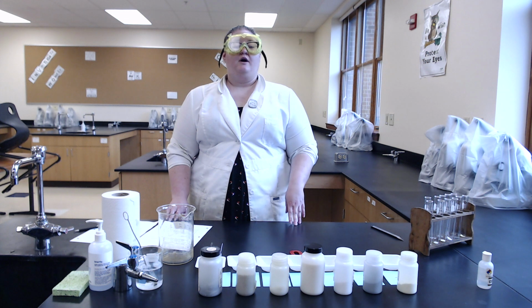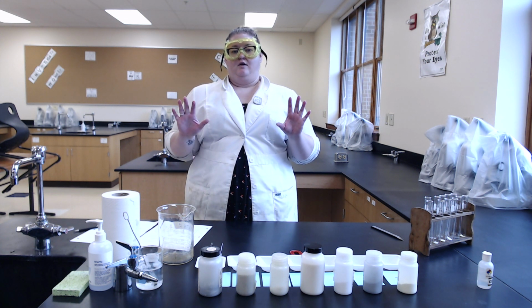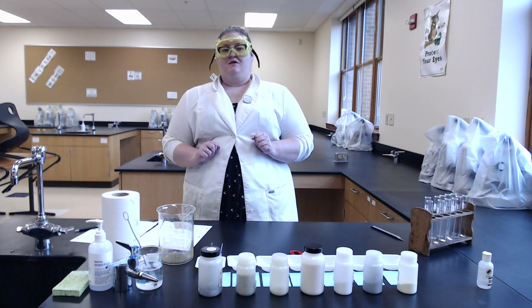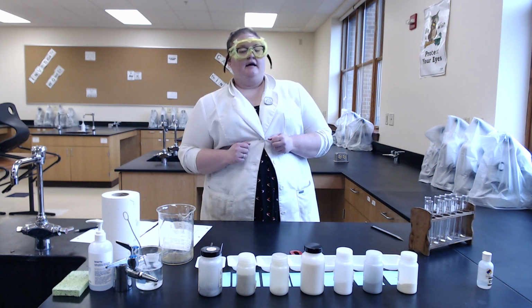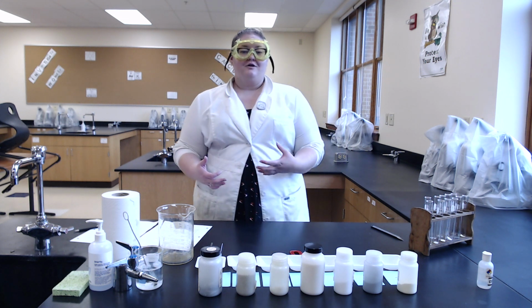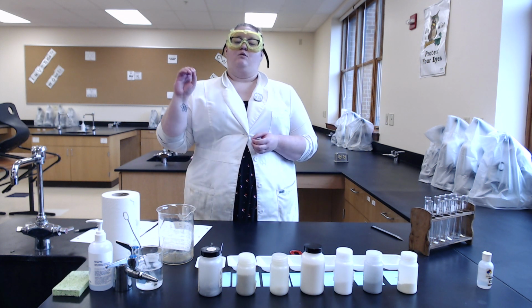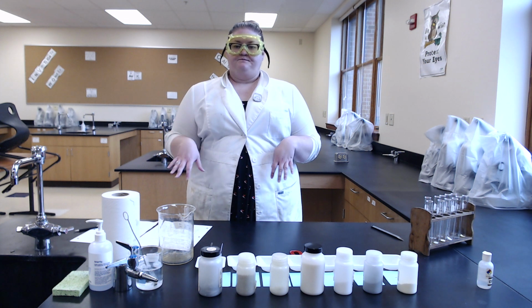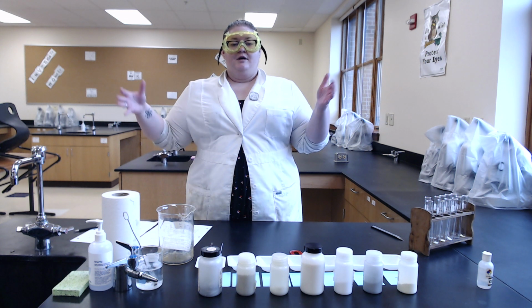So make sure that you have your lab handout open on one screen and your video playing on another tab. Okay? There's going to be one edit to the video because nobody's invented smell-o-vision yet. So obviously you are not going to be able to record odor or smell. So in the data table you can either just ignore that column, or if you want to, you can go ahead and put X's or shade in the boxes, but we will not be collecting that data because you can't do it.